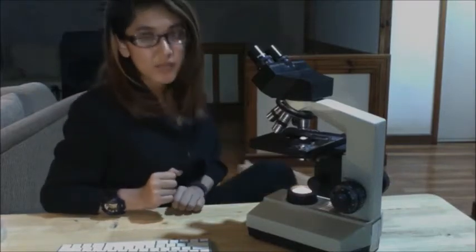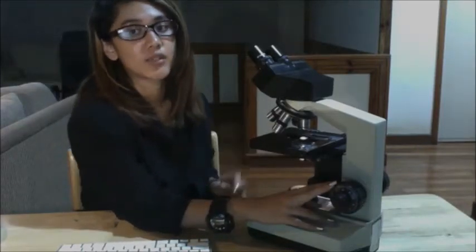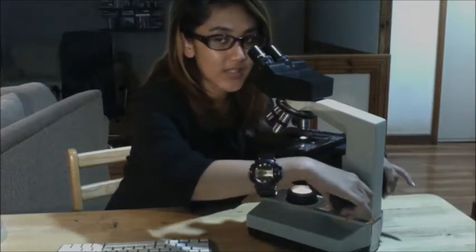Now that you have the lens in place and the specimen centered over the hole of the stage, you can now gradually raise the stage using the coarse adjustment until you reach a stop. So watch from the side of the microscope to make sure that the lens does not hit the bottom of the slide. So looking through only your right eye, focus by lowering the stage gently away from the lens by using the coarse adjustment knob.